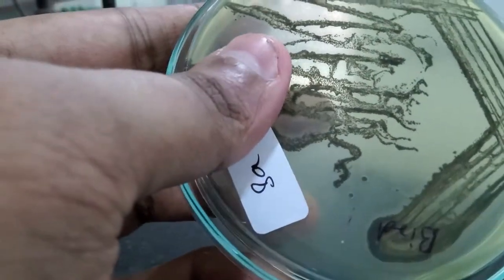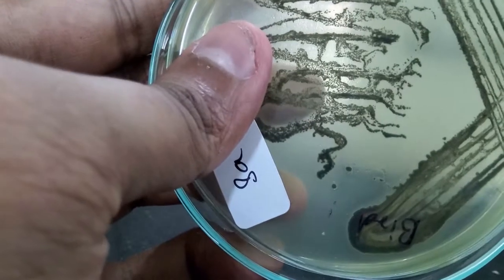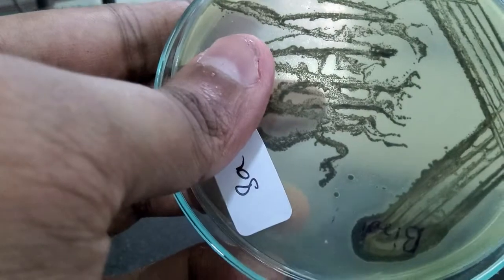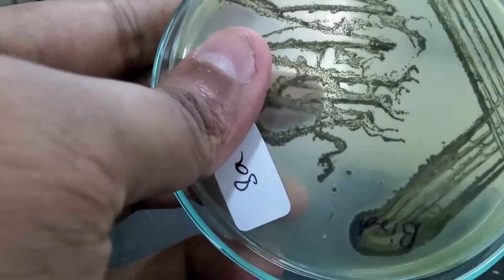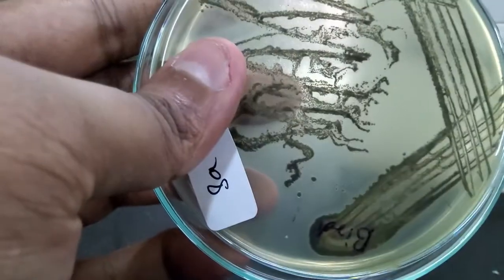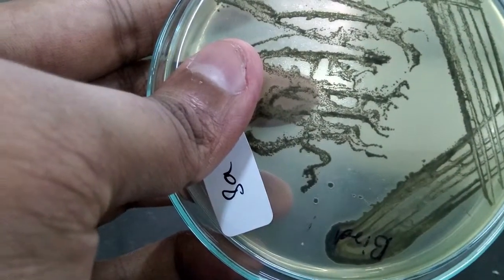There is a slight halo nature and beyond that a little clearance — it may not be very clearly visible, but as I slightly tilt the plate it becomes slightly visible. This kind of clearance appears only after 48 hours of incubation and may take a little longer to observe on Baird-Parker's agar. This is a clear-cut indication that S. aureus is a lecithinase producer.